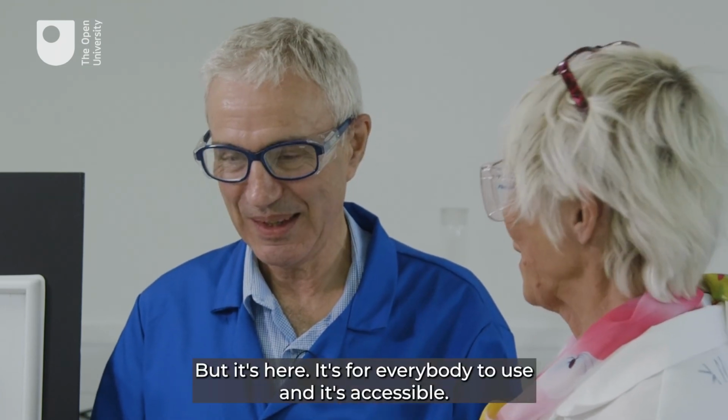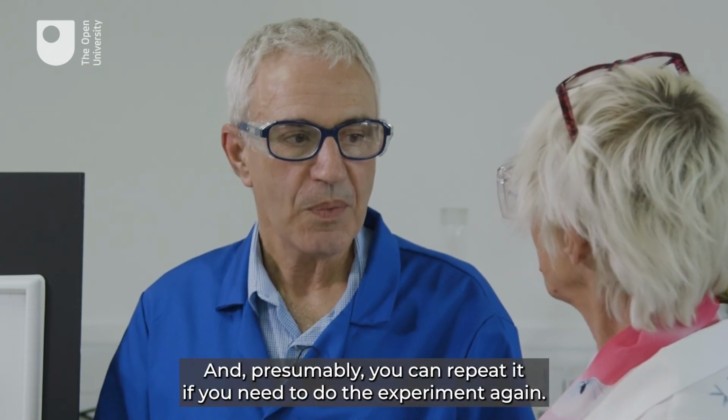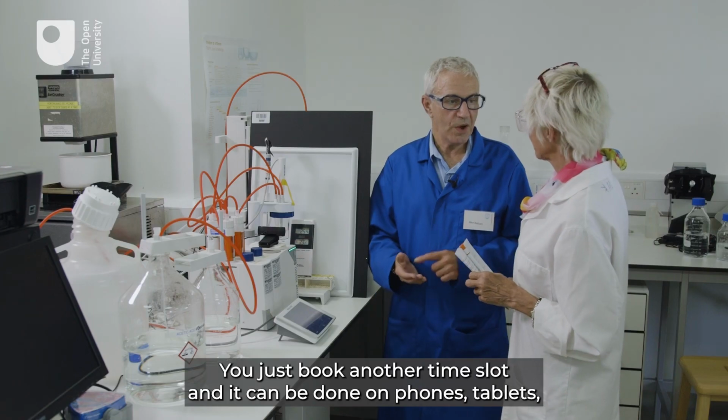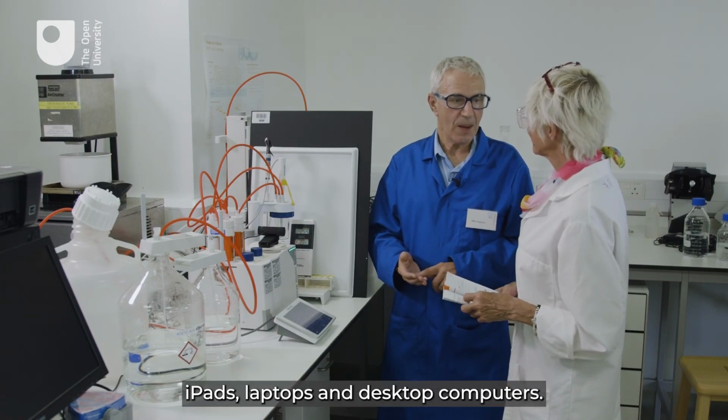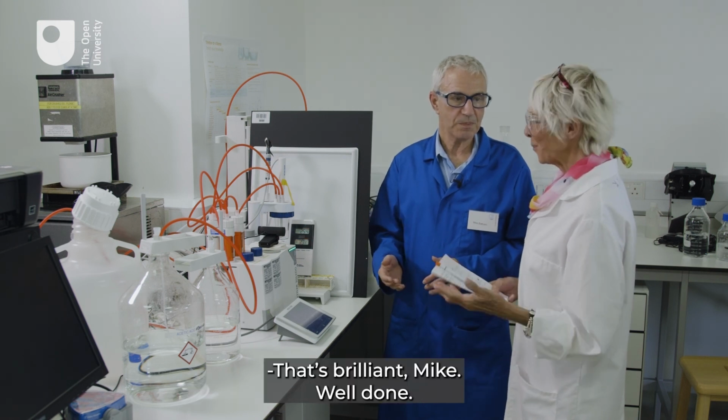Brilliant, but it's here, it's for everybody to use, and it's accessible, and presumably you can repeat it if you need to do the experiment again. Yes, you just book another time slot. And it can be done on phones, tablets, iPads, laptops and desktop computers. Oh, that's brilliant, Mike, well done.